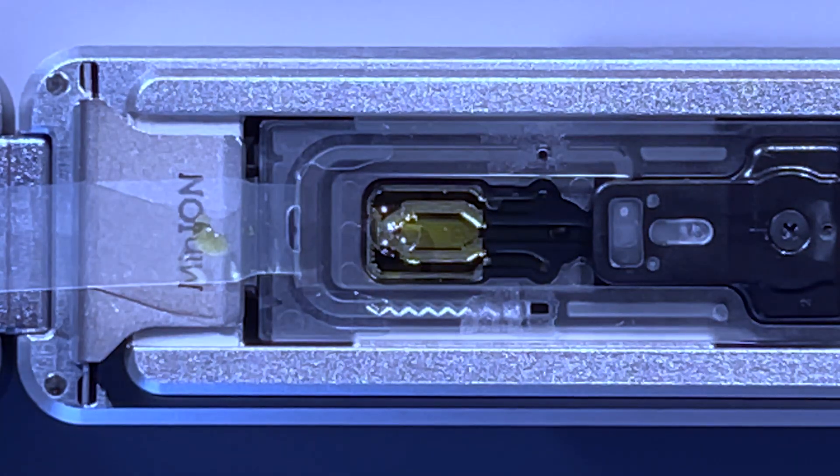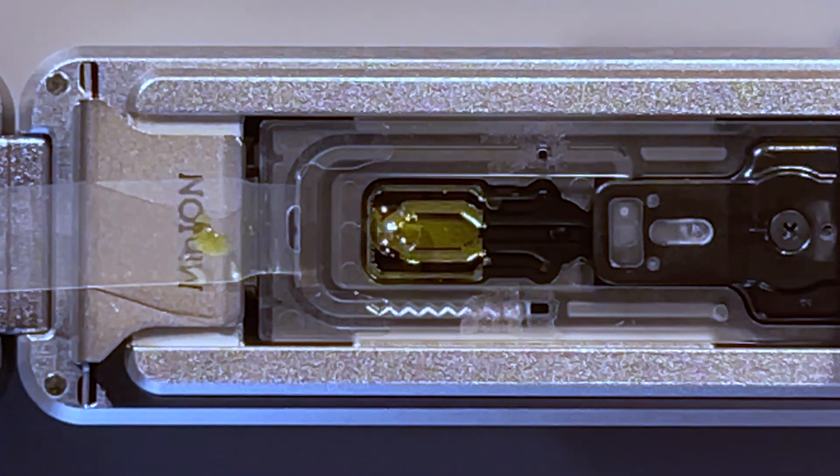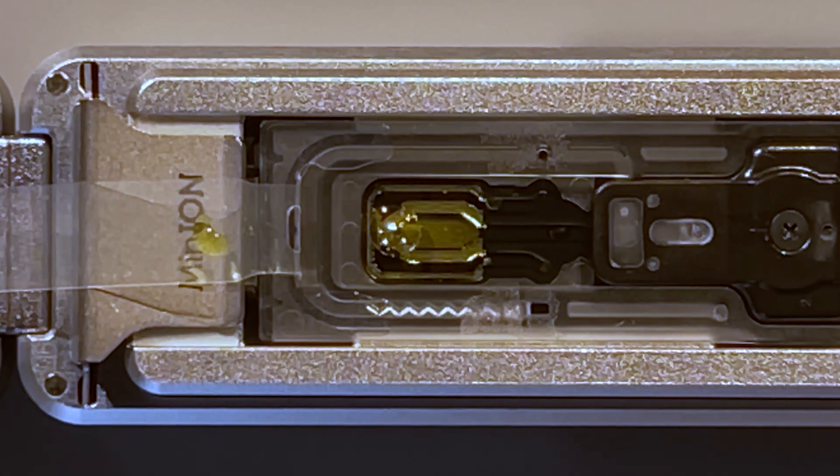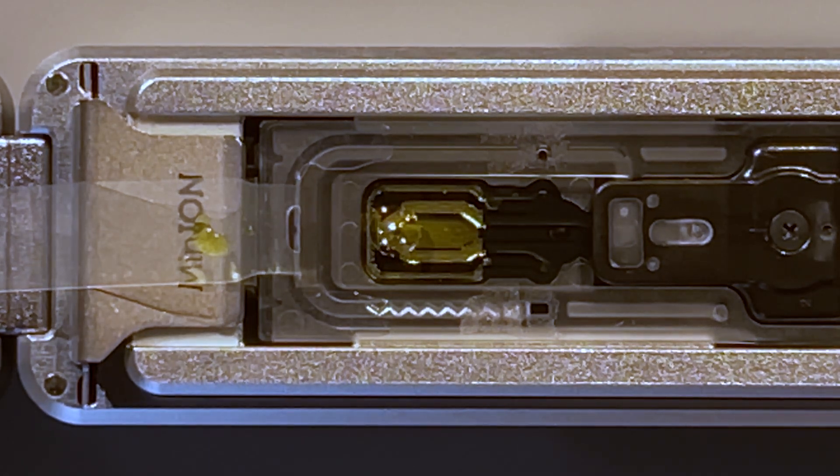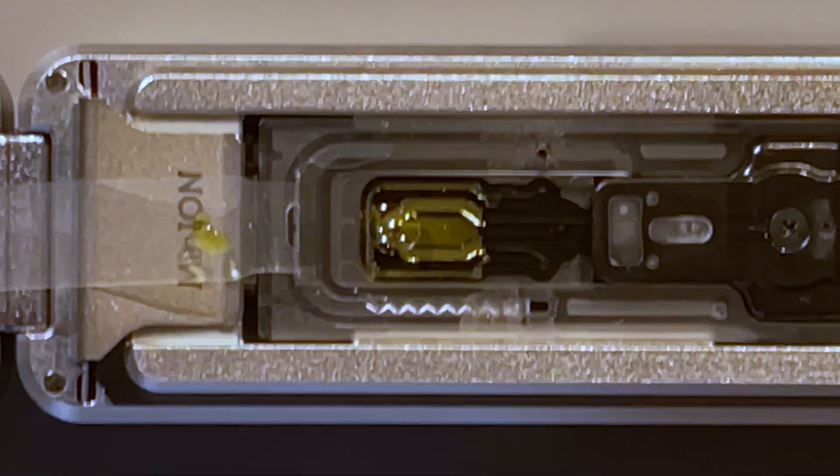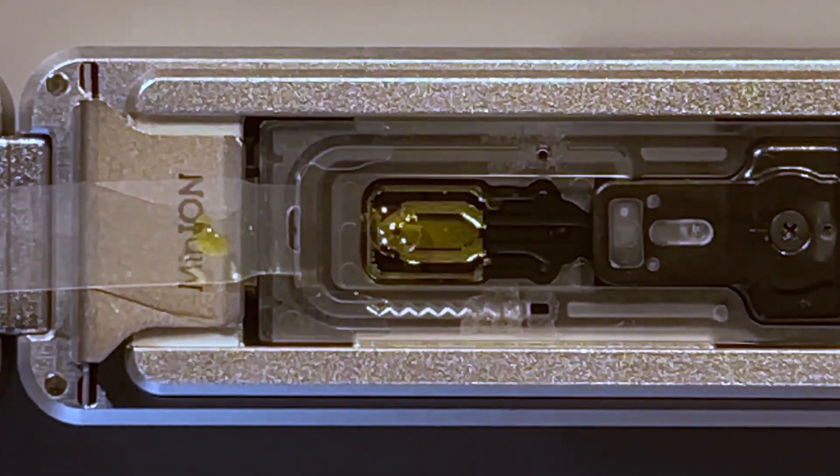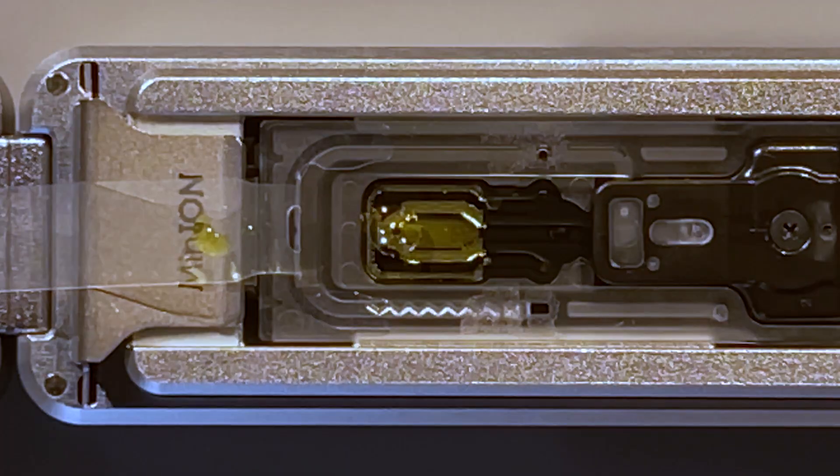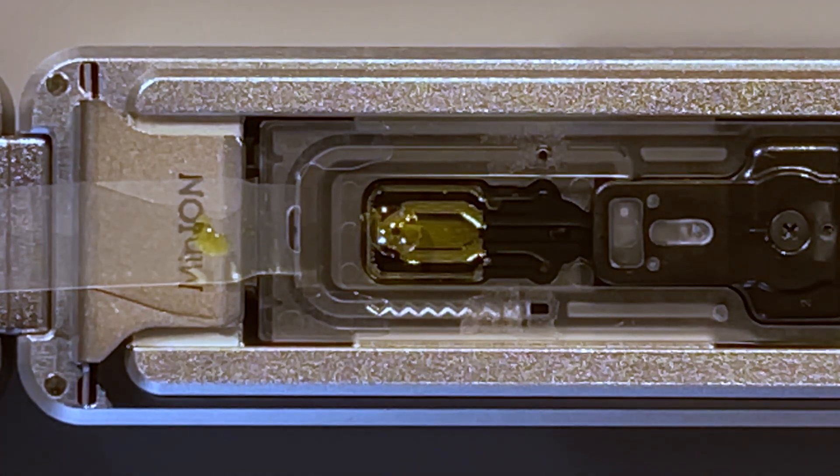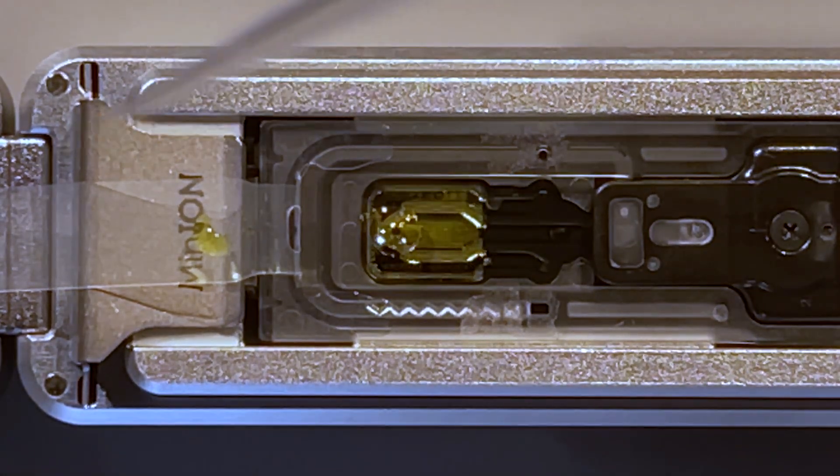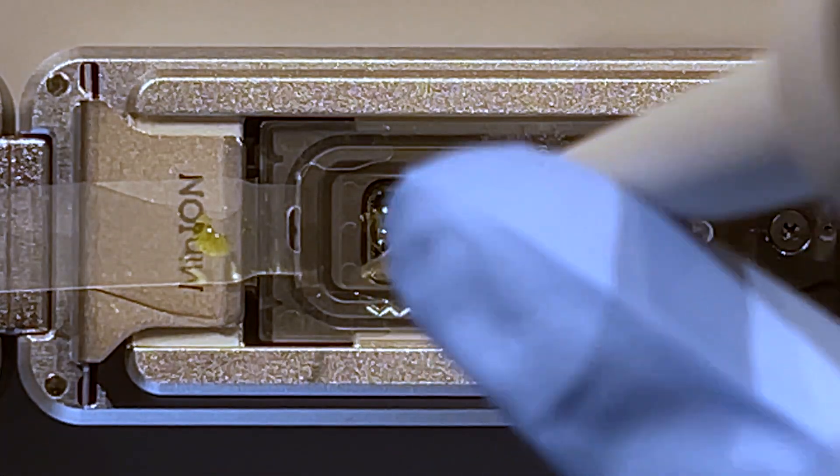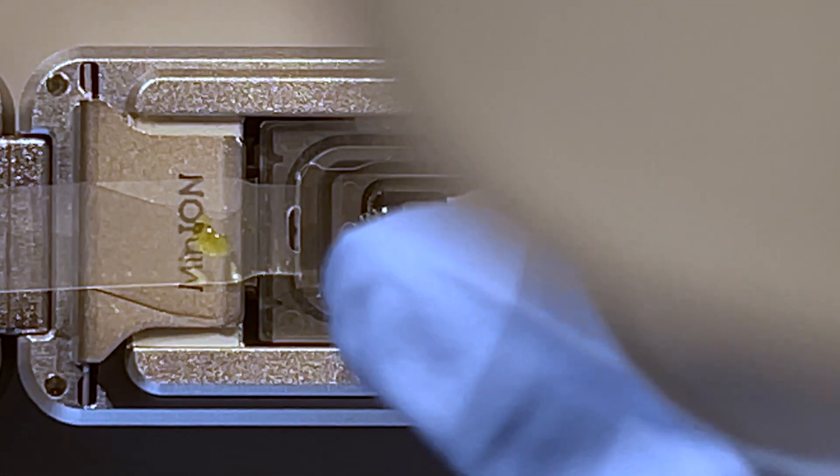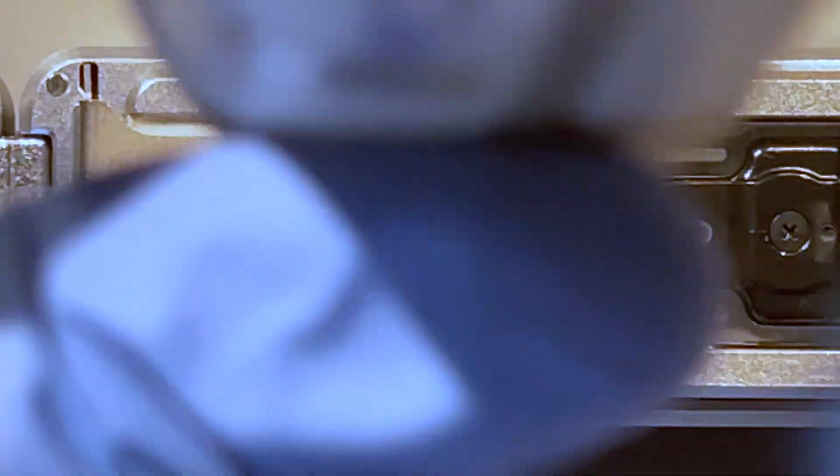So I'm going to go ahead and grab that. I happen to have P100s, so I do 100 microliters or a little bit about 100 and go back in for it again if I need to. I've got my flush, and let me just get the liquid in there. Let me tap this, get down to the bottom. The really key thing to do here is not by any means introduce any air bubbles.